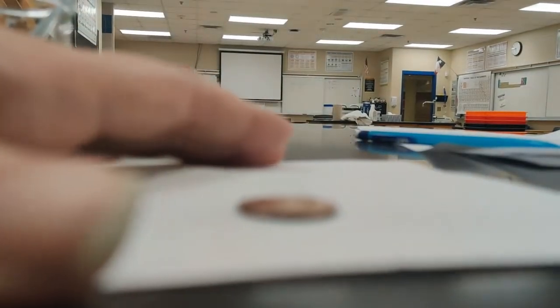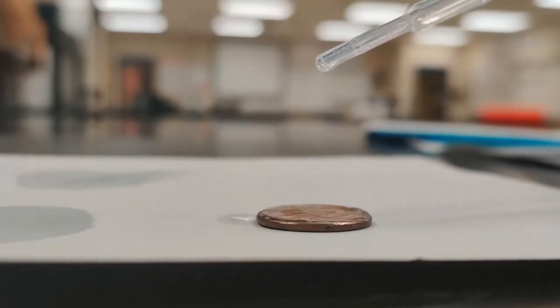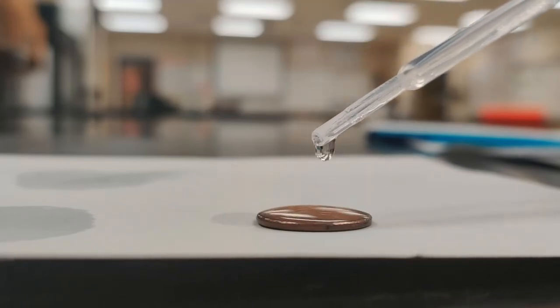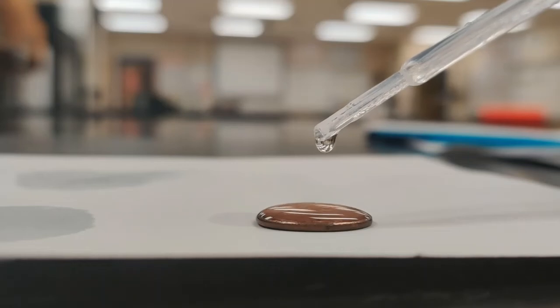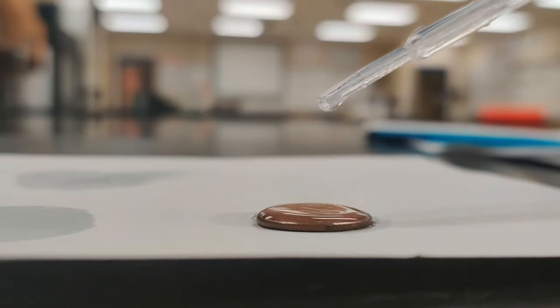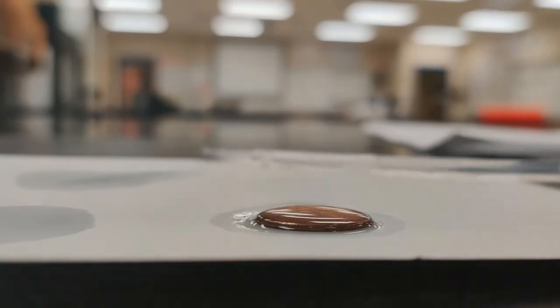I don't know. So we've got our soapy water data, and now we have one more thing to try, which is our methanol. So we'll do that here in a second. One thing about methanol is that it has an extremely low boiling point. 1, 2, 3, 4, 5, 6, 7, 8, 9, 10, 11, 12, 13, 14, 15. Oh, there we go, 16. Looks like 16 for our first try with the methanol.